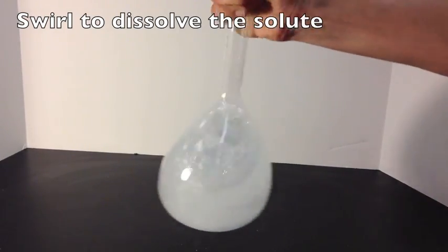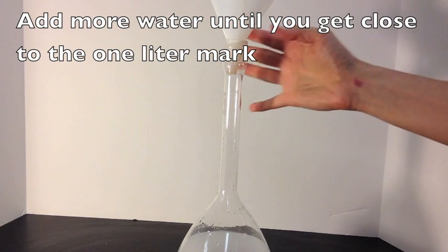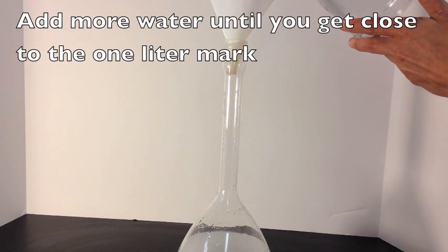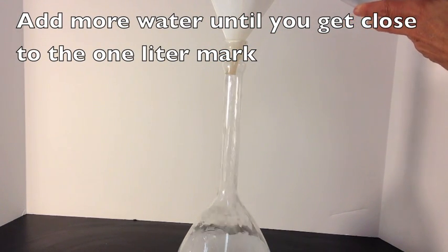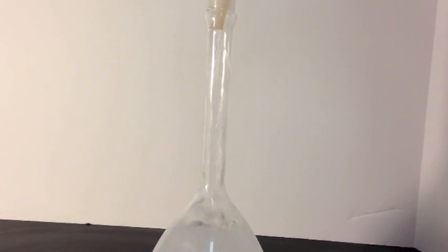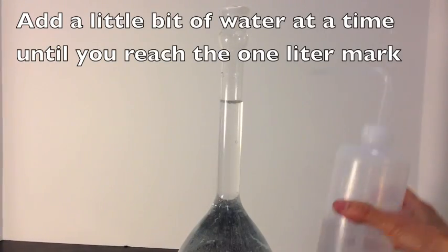And then you're going to add some more water. Now you have to be careful here because you don't want to exceed the one liter mark. So you keep adding water quickly until you get close to that one liter mark, but you don't want to exceed it. So stop before you reach that point.